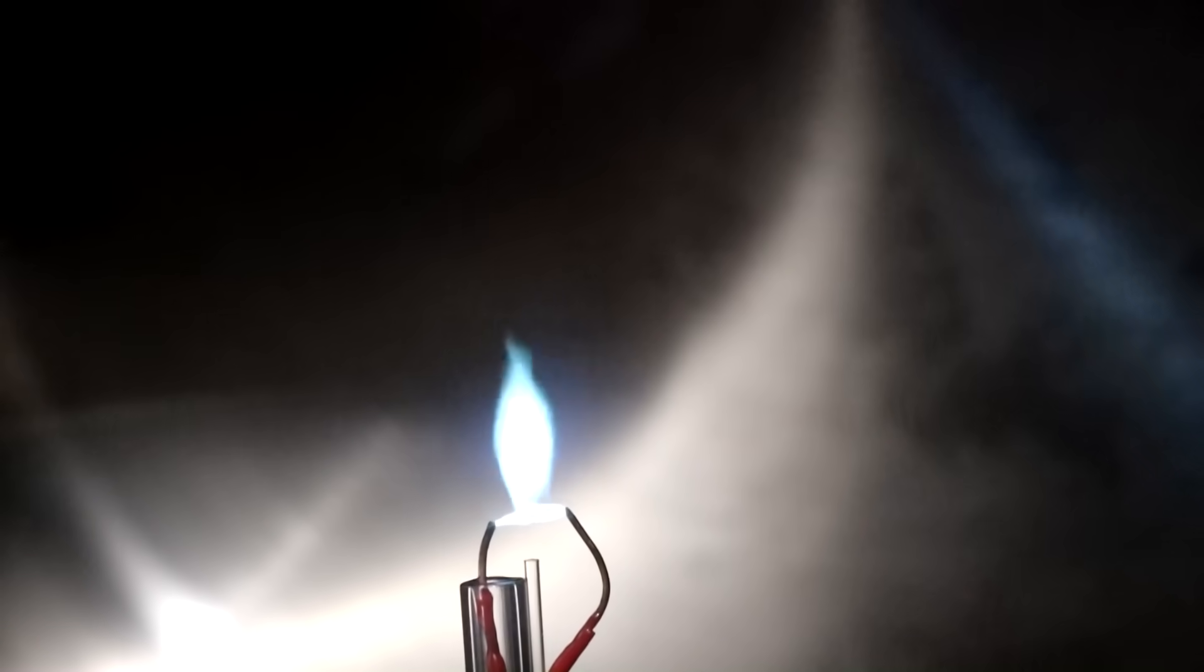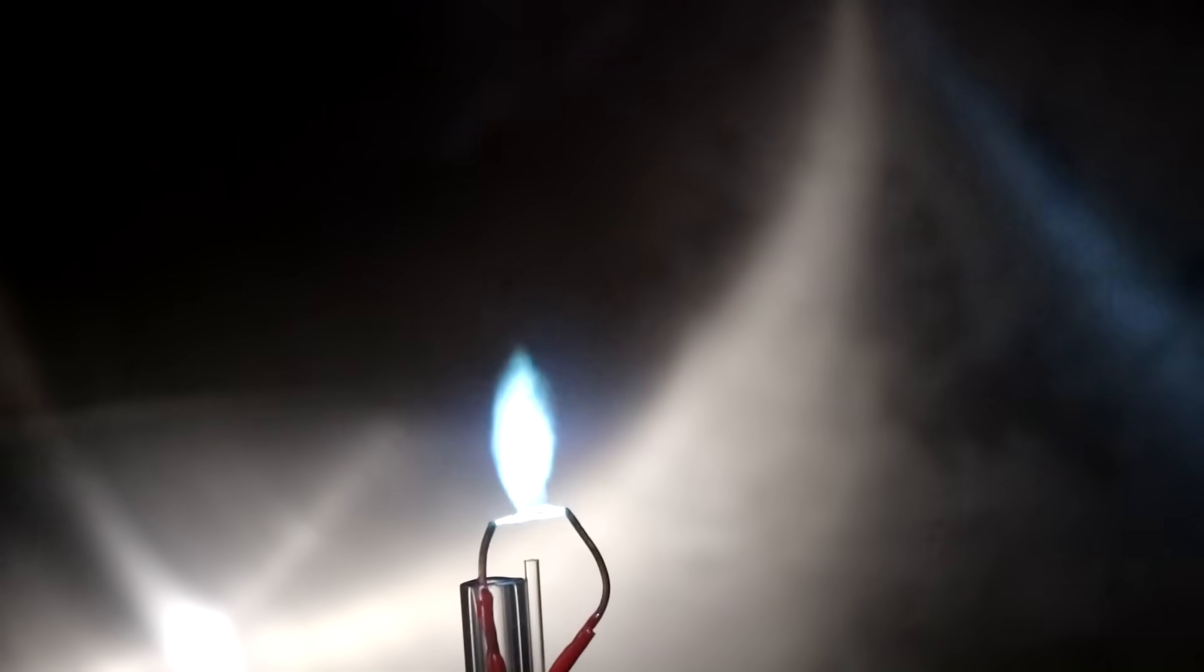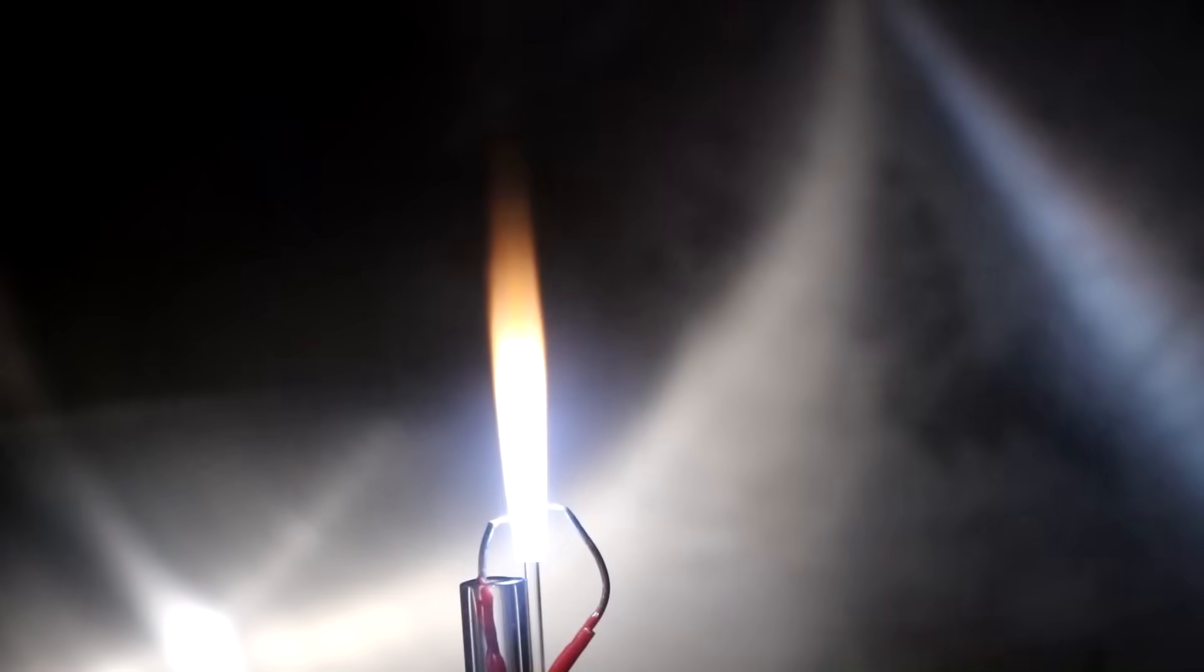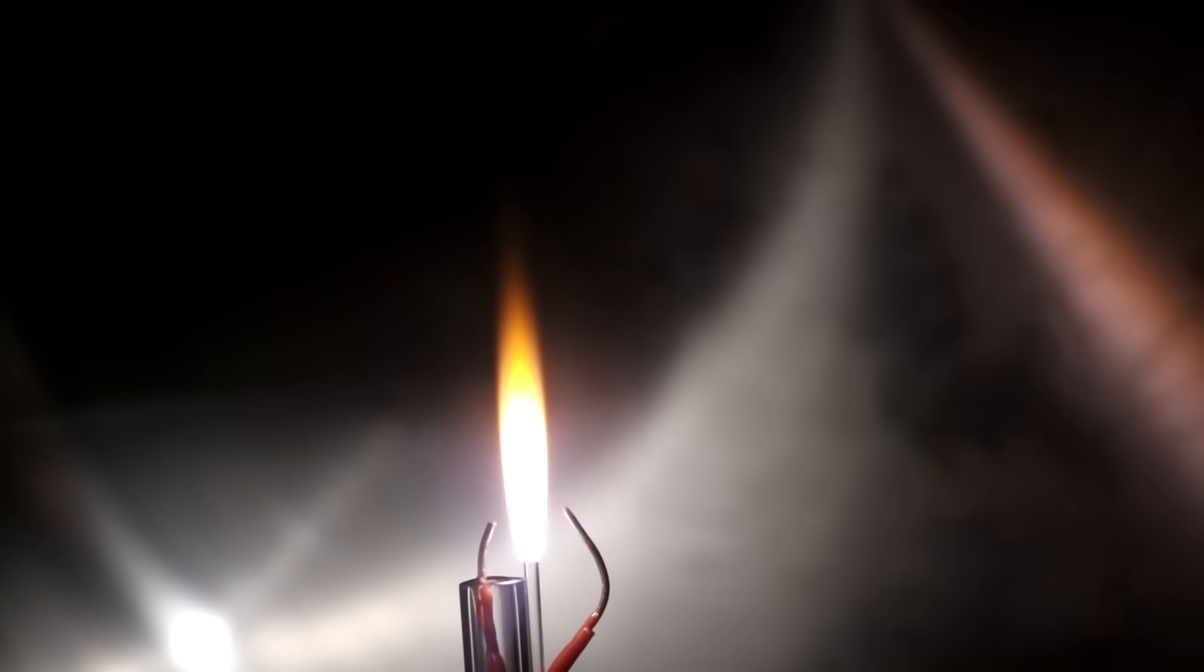Oxygen is going in. There it is. Oxygen burning in a propane atmosphere. Oh, that is working better than I thought. Let me turn this light off. That is different, isn't it? Different colors and everything. It's probably burning hotter.